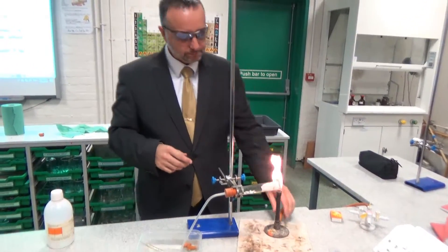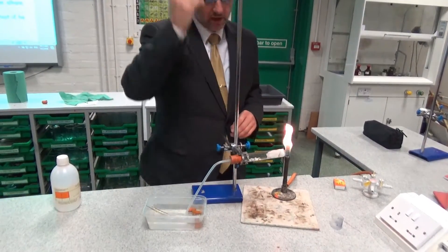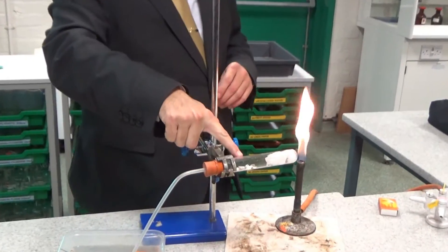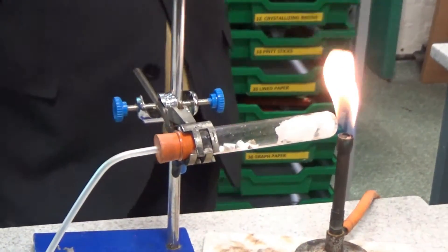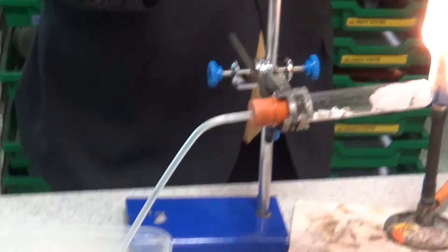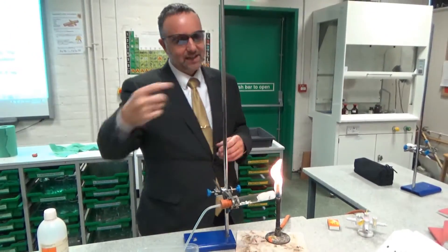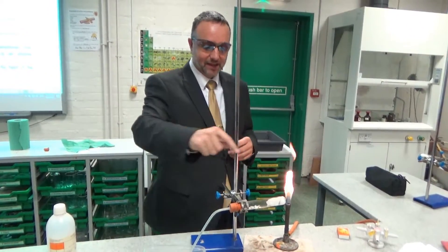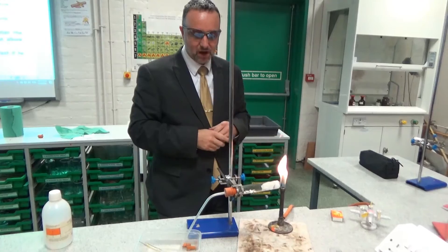So what are we doing? We've obviously got a boiling tube here, we've got some cotton wool, and that cotton wool is soaked in paraffin. And we have here some bits of broken up plate — just your average household plate. What's that doing there? Well, some clever scientists figured out that broken plate will act as a catalyst for this process. A catalyst is a substance that speeds up a reaction without being used up, and it will speed up this reaction of cracking, breaking those molecules apart, without being used up.